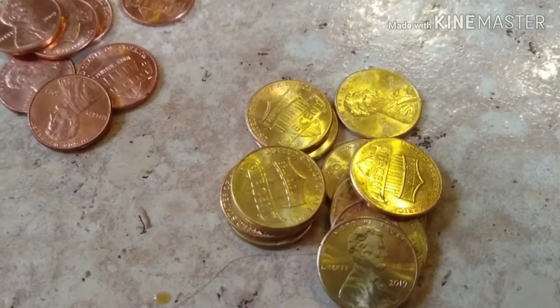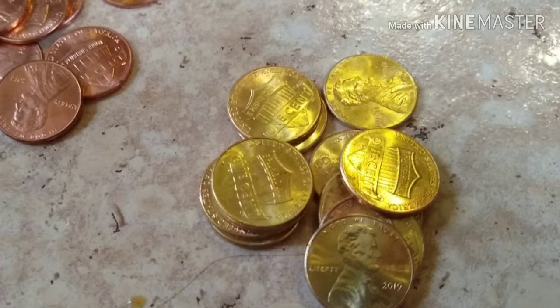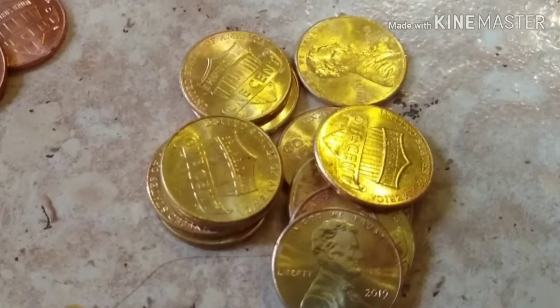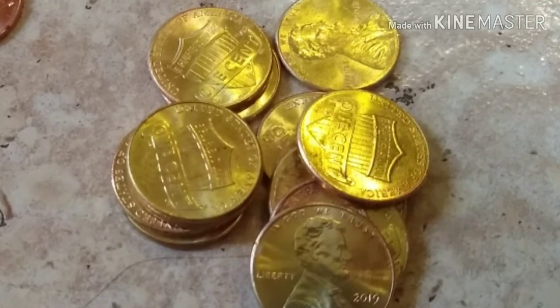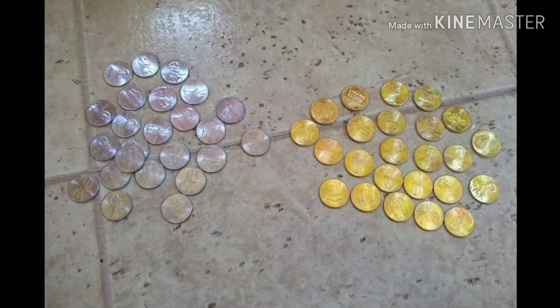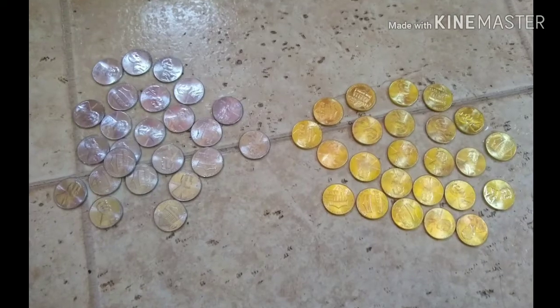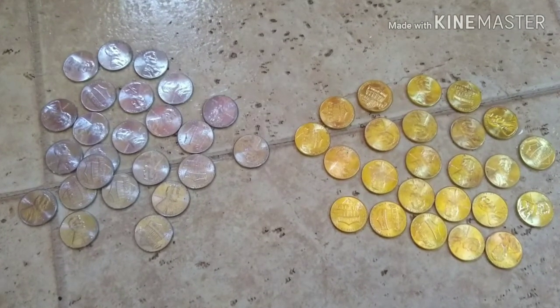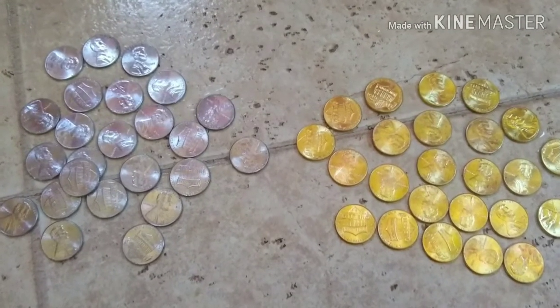Find a penny, pick it up. All day long you'll have good luck. Well, we're about to make our pennies extra lucky today by alloying them with another metal to make it look like they're silver and gold.